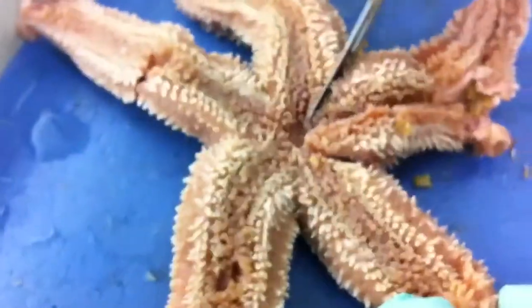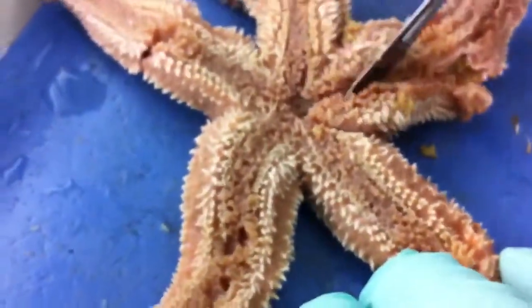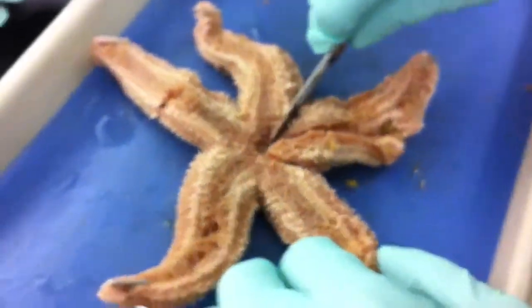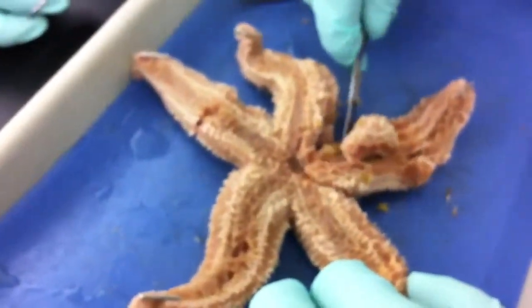Are we supposed to just cut off one then? Yeah, we'll do that in a minute. I'm trying to get to the middle — the middle part of the video. Like this... this bubbling. The source of the bubbling.